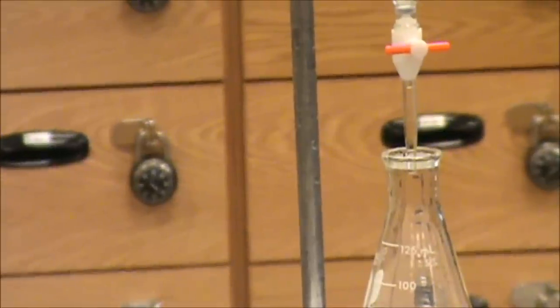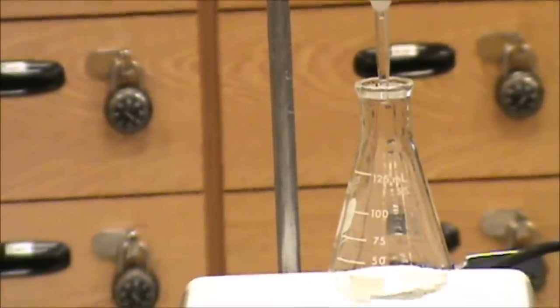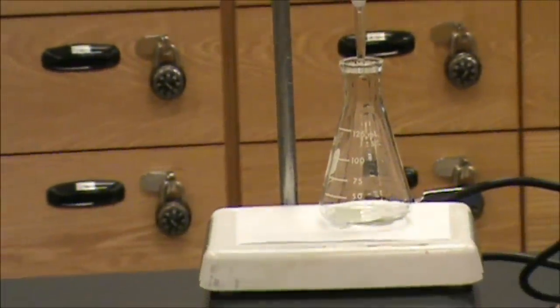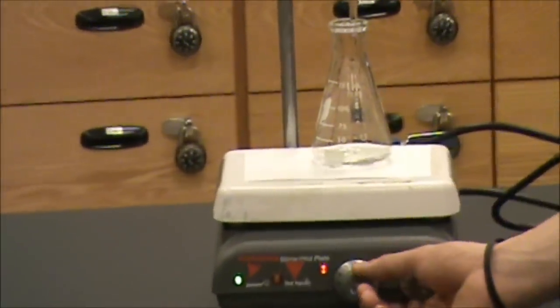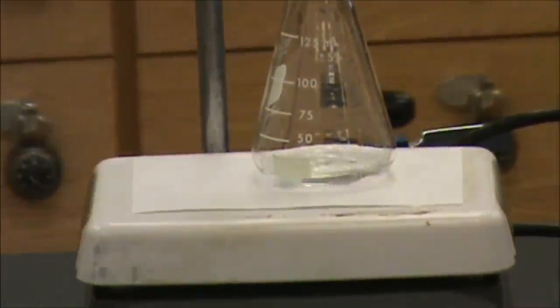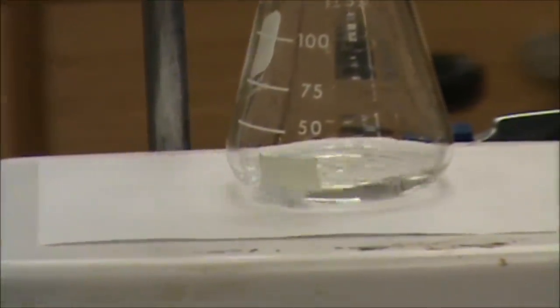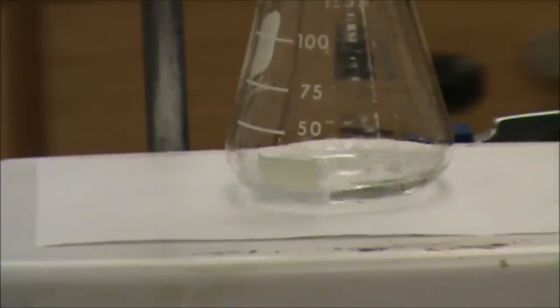I am now going to turn on the stirring. You want to adjust the rate so that we have a good amount of stirring without splashing. That's pretty good right there.